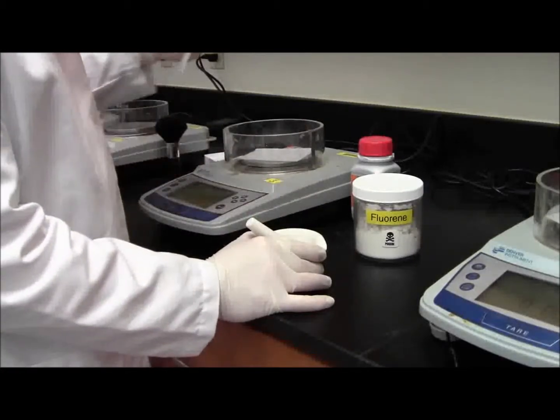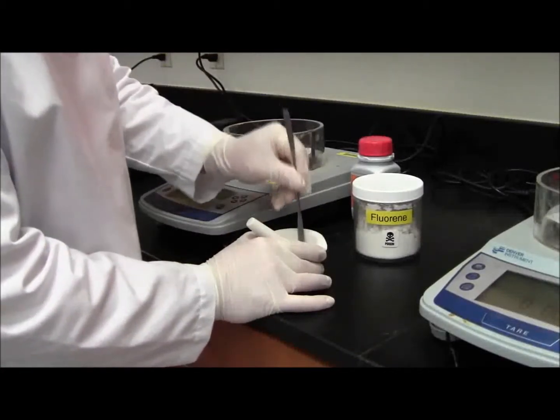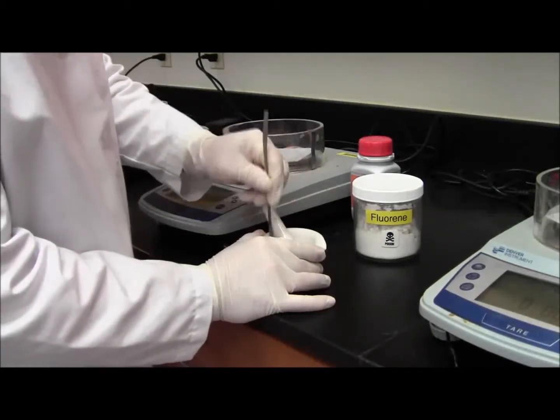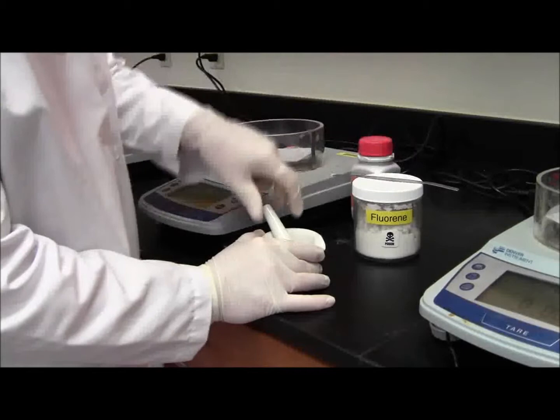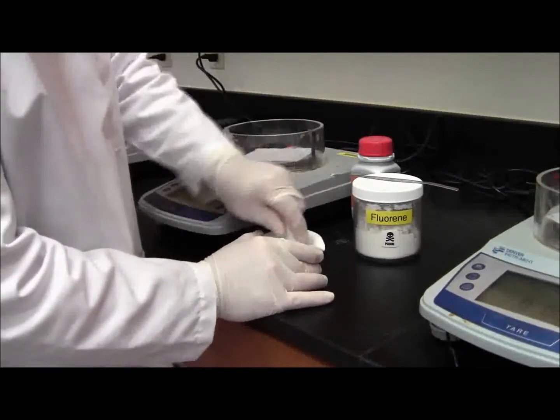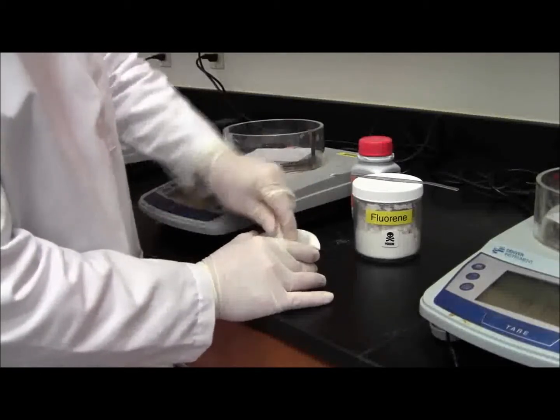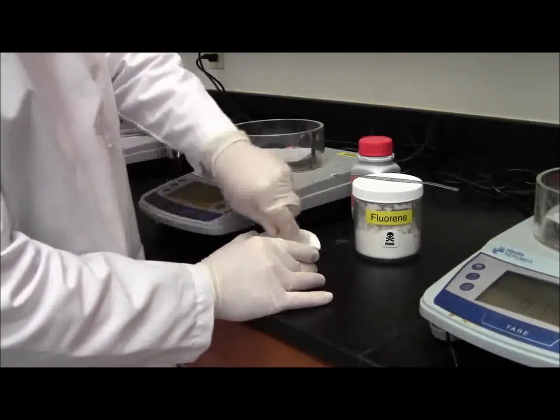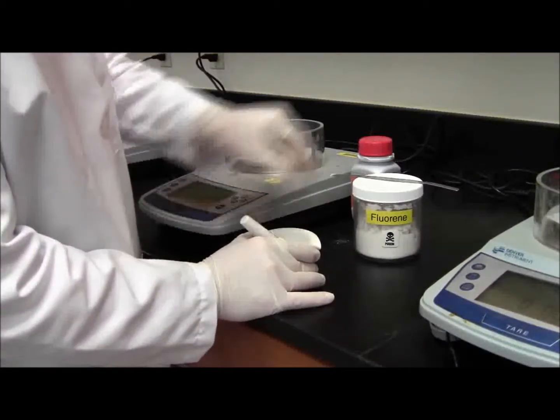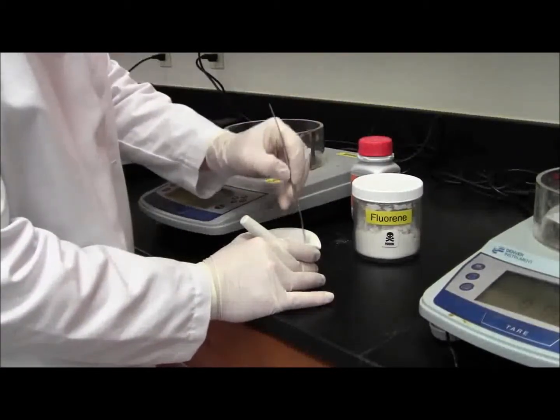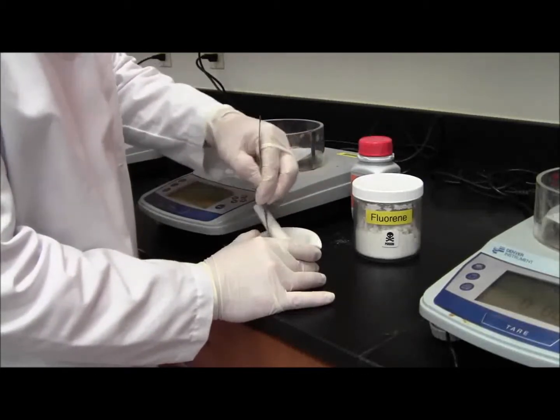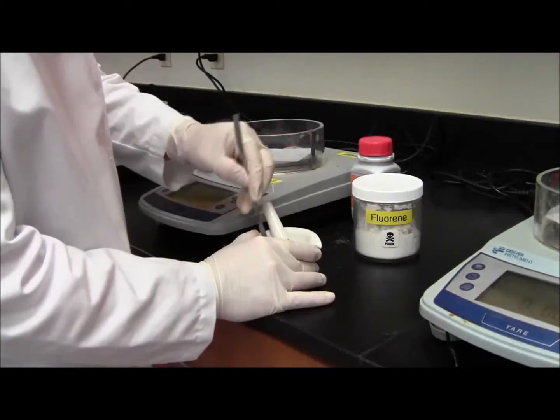Grind it for a little bit. Take the spatula and scrape down the sides a little bit. You're going to do this until you get a fine powder.